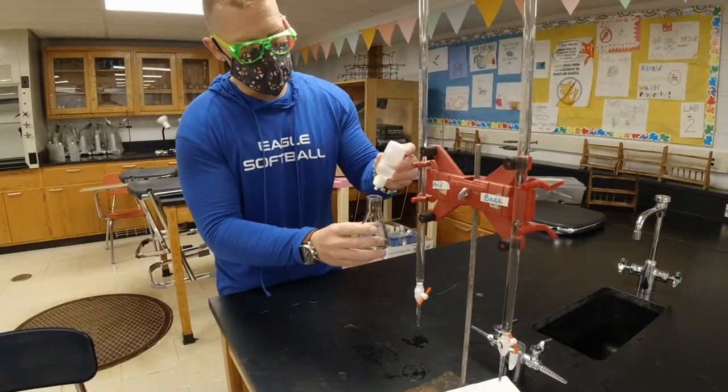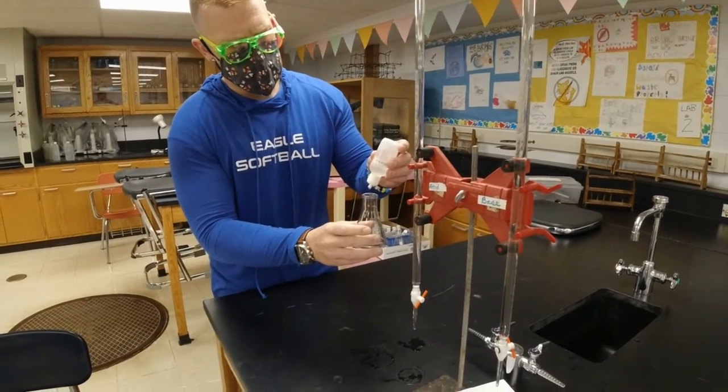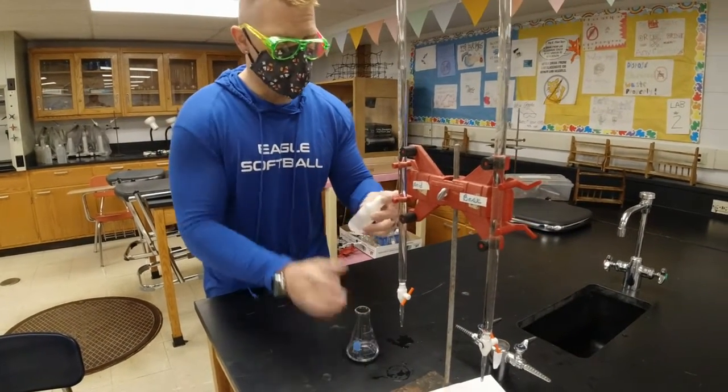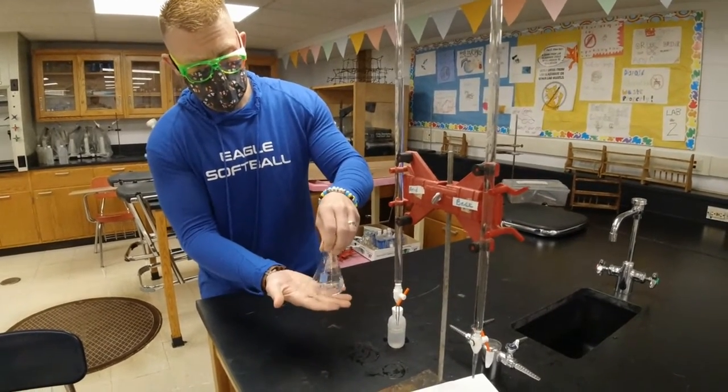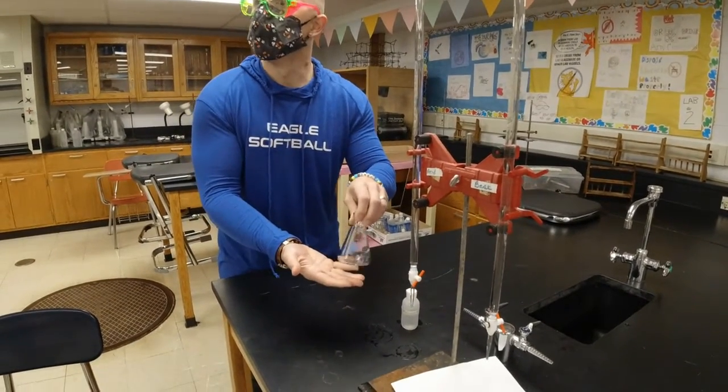How many drops you want on there, Mr. Brown? Oh, 1, 2, 3, whatever you feel like comfortable doing. 3 is my lucky number. I was born on 3/23/83. Wow, that is lucky. Mm-hmm. Lucky for my parents, too, that I was a gift to them.